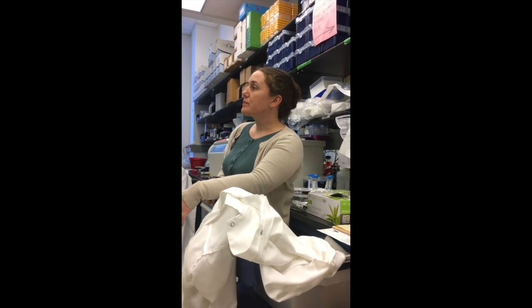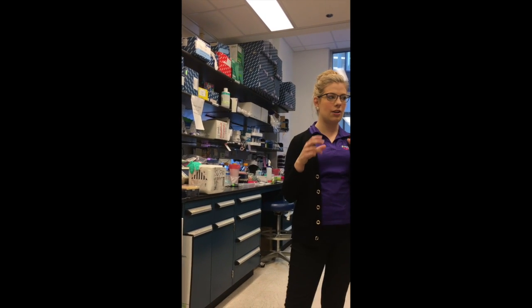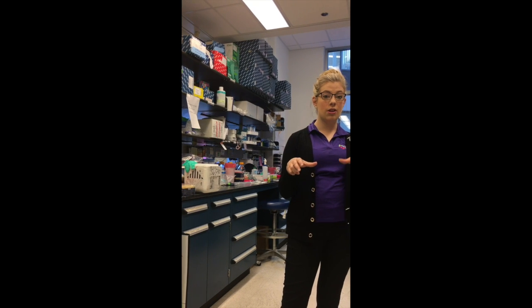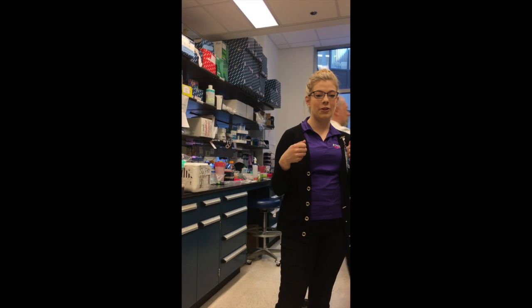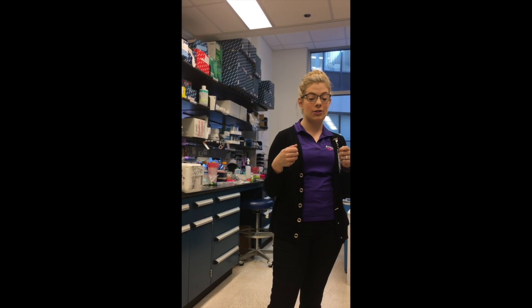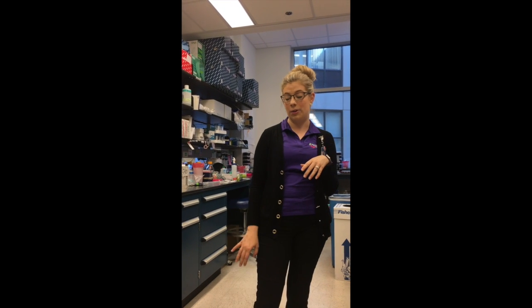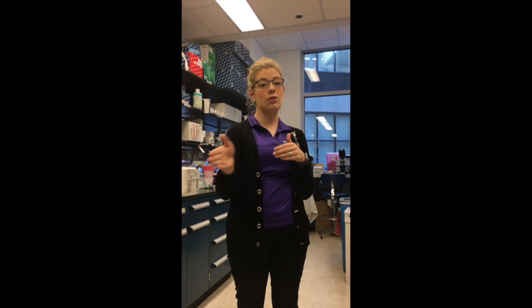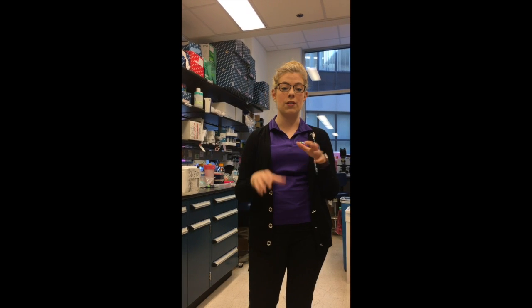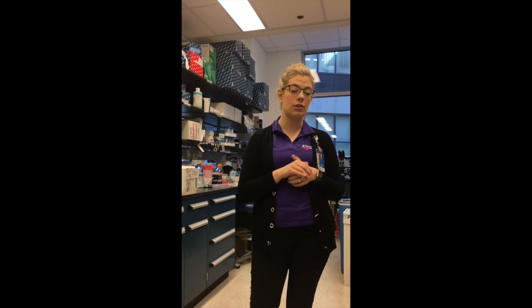It also lets you see the movement of cells, because if you look at this picture, it looks so stationary, so still. But your cells are moving, and they're constantly going through cell cycles. So it's not just that they sit there. This is fixated on a slide with the pictures that you see. So that helps you see that your cells really do move. The eosinophils move through the tissue as well. That's why you see them within the tissue instead of on the outside, because they've been able to move between cells to get into the tissue.